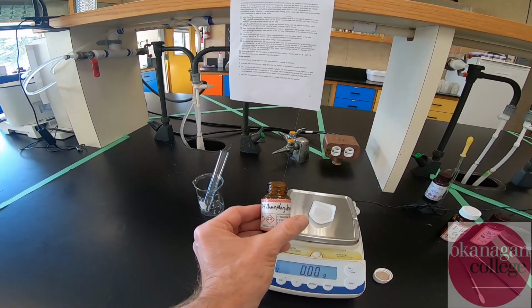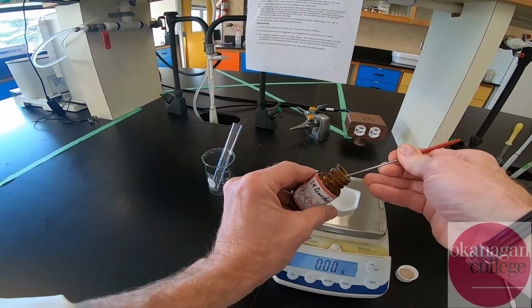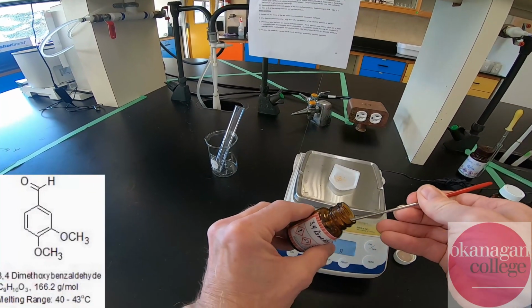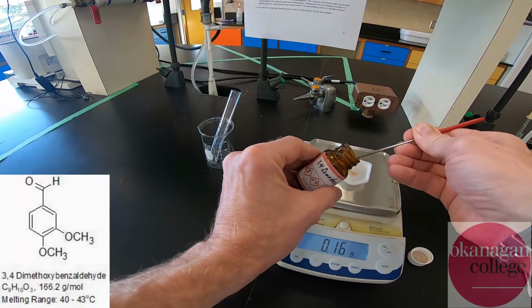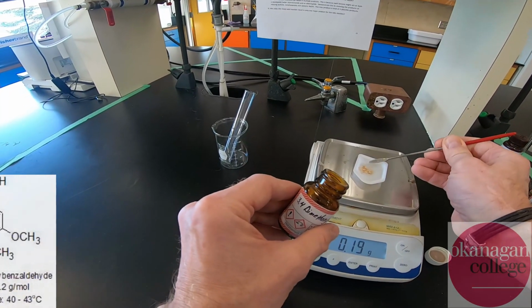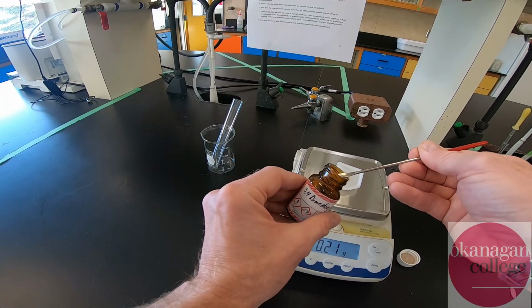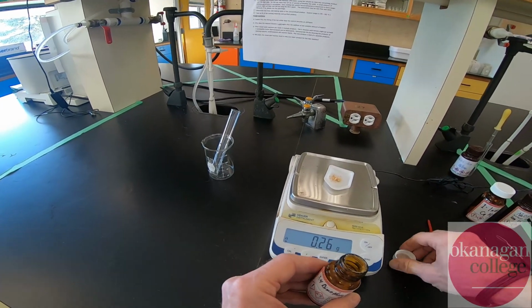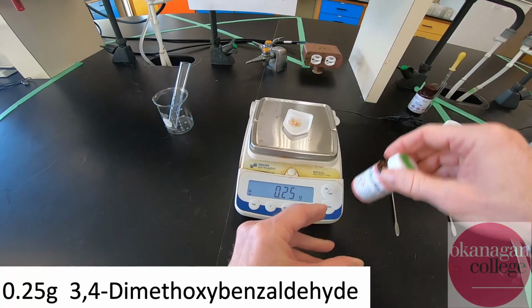So the first reagent we're going to use is 0.25 grams of the dimethoxybenzaldehyde. Need about 0.25 grams. You can see, though it's a solid at room temperature, the melting point I think is in the low 40s, high 30s degrees Celsius. We are going to try to do a yield calculation in this lab, but you'll see a little later that the transferring of this material is sometimes a little difficult. Also, we're going to do a recrystallization. So we're going to record that as 0.25 grams of the benzaldehyde.